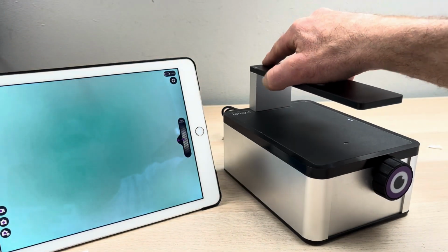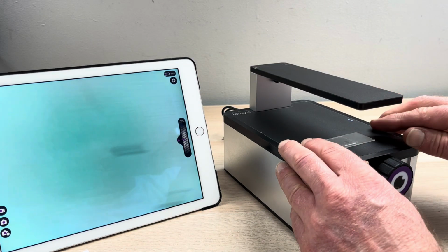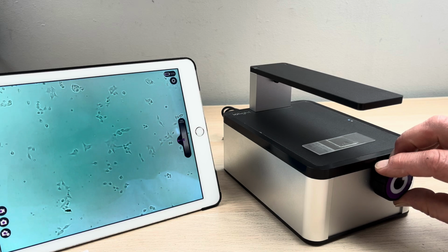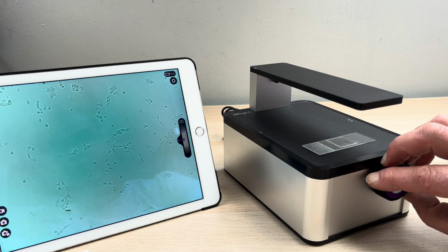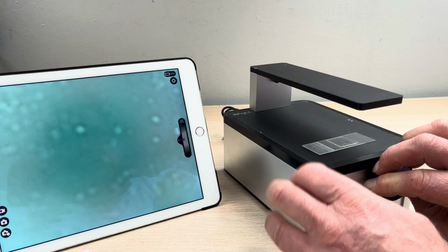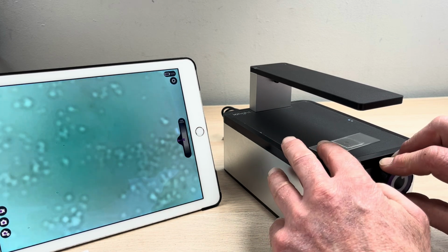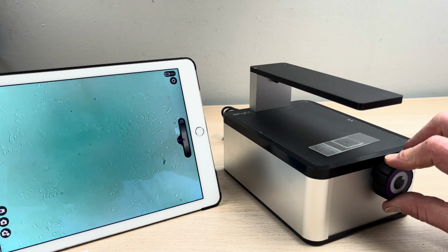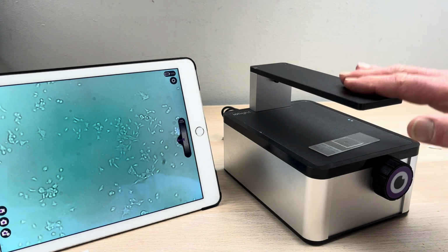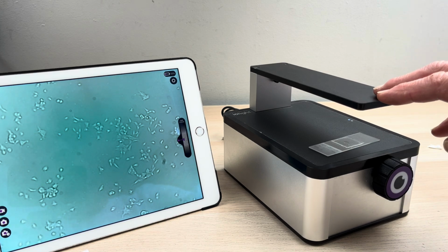And if we look, there we go. The window is beautifully clean. Let's put the slide of the HEK293 cells back on. That's it, you can see the cells beautifully. And if I move the focus around, I don't see any dirt on the sample stage. There we go. That's how to clean the optical window on your ioLight compact cell imager. That works for both the fluorescent version and the brightfield version.